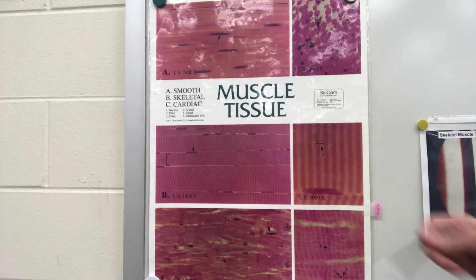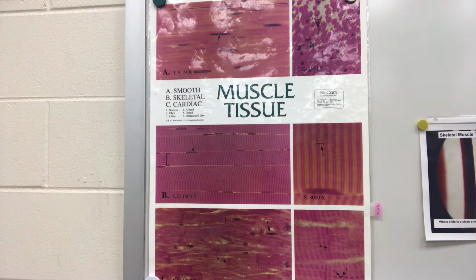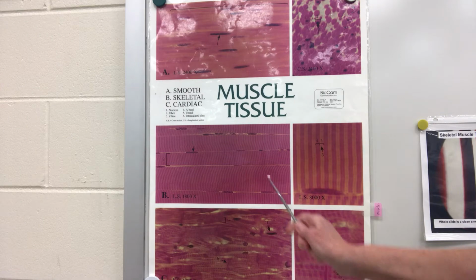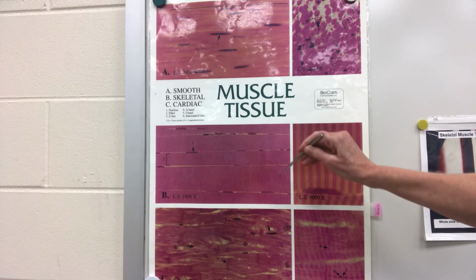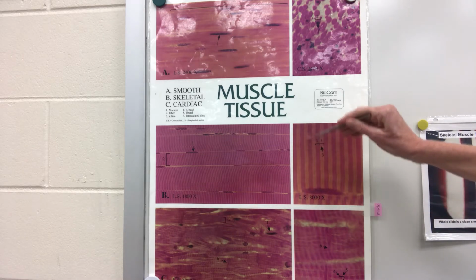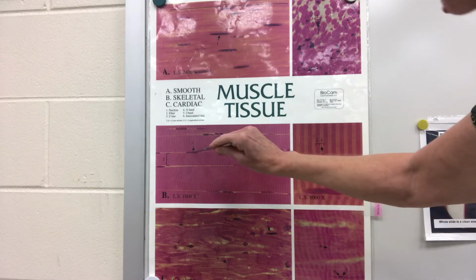We will look at the skeletal muscle, which is the muscle you're most aware of, that makes up your biceps brachii and your triceps brachii, and what you think of as muscles. Things you want to look at with this is that these are going to be long tubular cells. They're going to have striations. That's a fancy word for stripes that go across the cell and down, so you have this banding pattern. You can see it up much closer here. And they will have long, thin nuclei pushed to the outside.